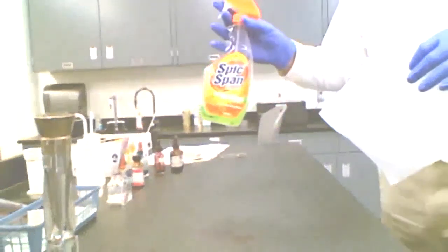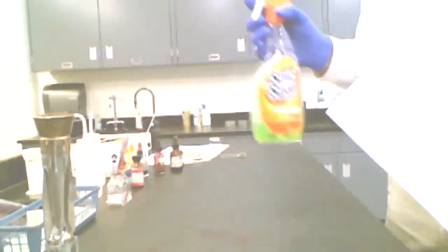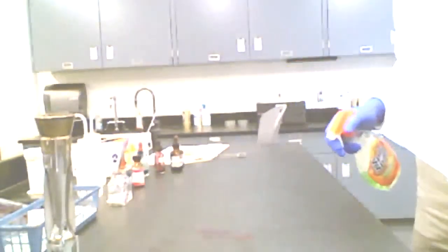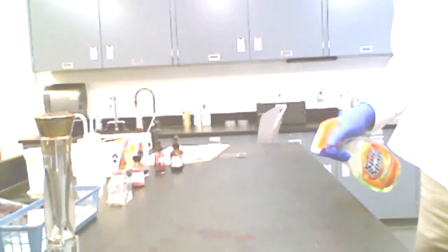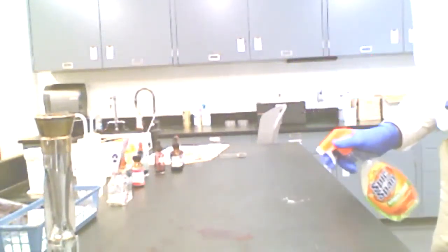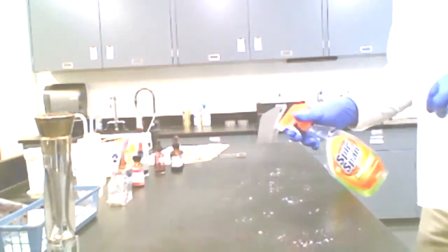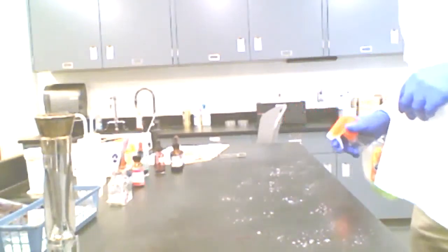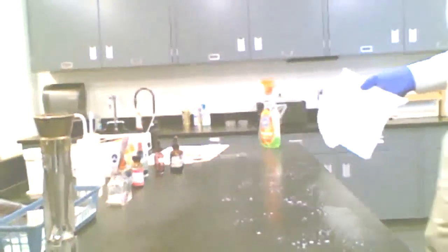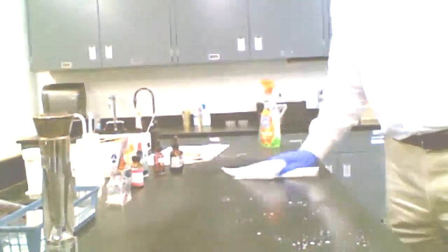So I'm going to use a bleach-based cleaner, or there are some other agents that are suited for this. I'm going to go ahead and spray down my work area, if I can get it to go. This might be a little bit slow. Just cover that liberally with your spray. Lysol works well. Phenol-based disinfectants are sometimes used. I'll let that sit for a little bit, and then I'm going to wipe that down.